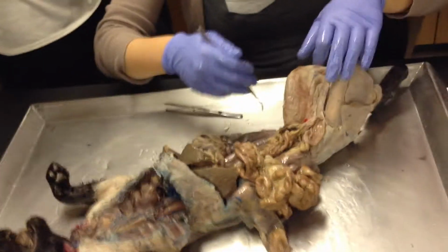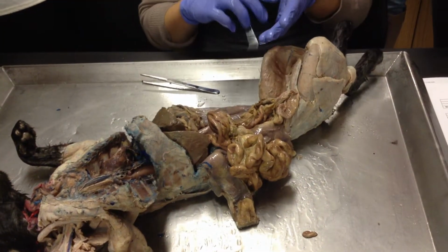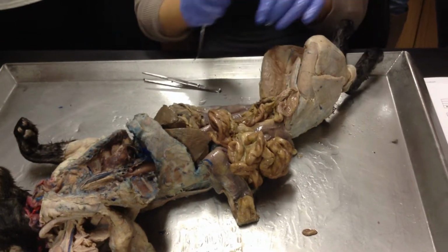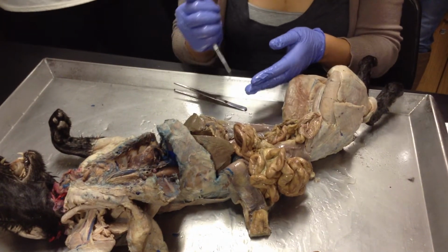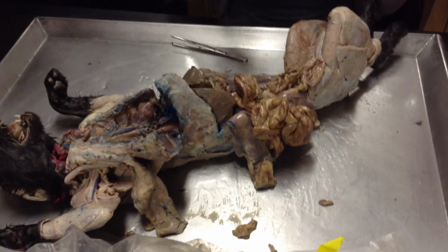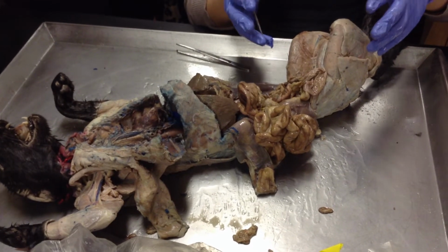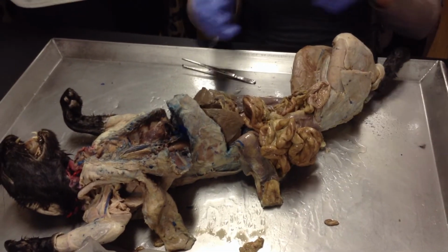All right. In addition to that entire tube that we talked about, notice that I didn't talk about the liver or the pancreas or the gallbladder, because it's not a tract where food flows through. But those three organs are still very important organs that contribute to digestion. How does the liver sort of contribute to digestion? Produces bile. Bile helps you break down food. That's why it's included in the digestive system organs. Okay. So bile is important. The gallbladder stores it, so it's important. And then the pancreas, I gave it away.